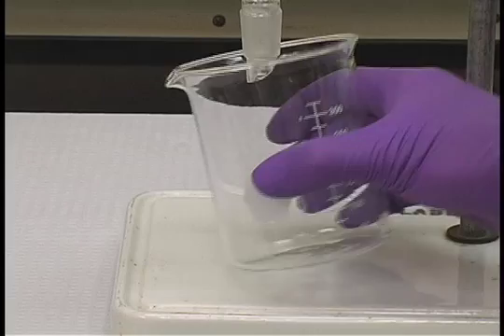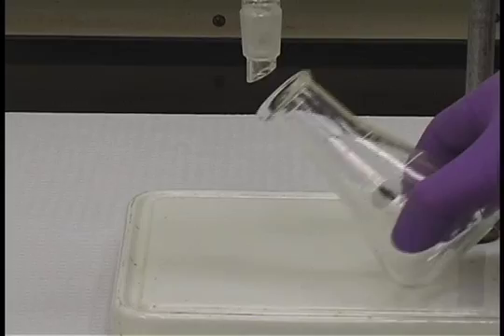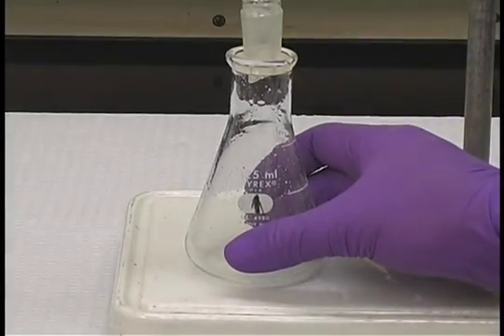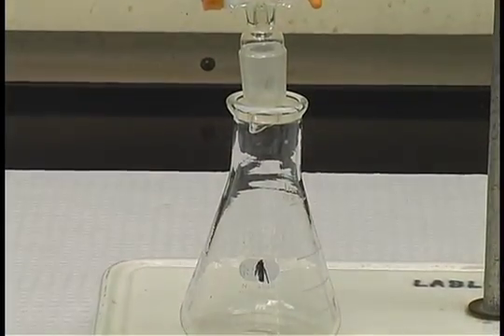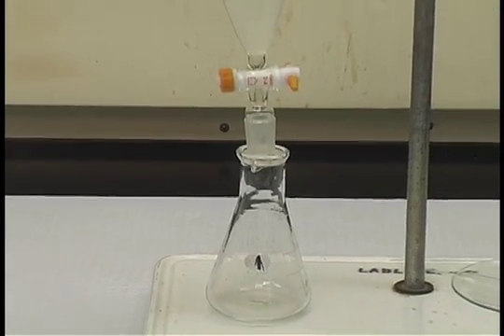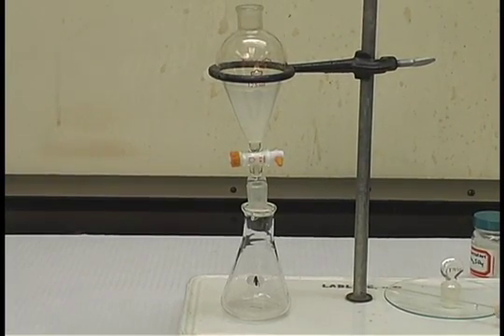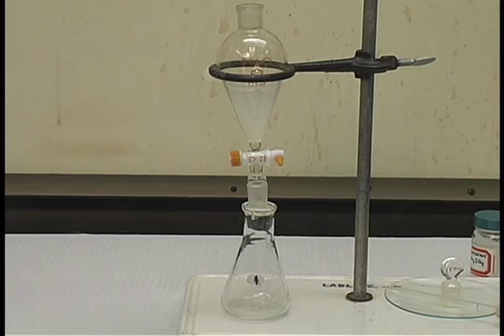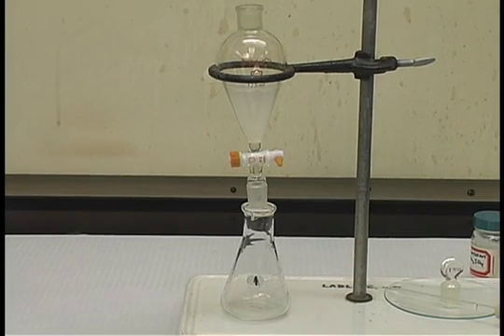Replace the beaker with an Erlenmeyer flask that will serve to catch the extracted solution. Very often you may not know which layer is which. You can test this by adding a solvent to one of the two layers. In this particular case, I know one of those solutions is in fact aqueous, so I will test it using a drop of water.